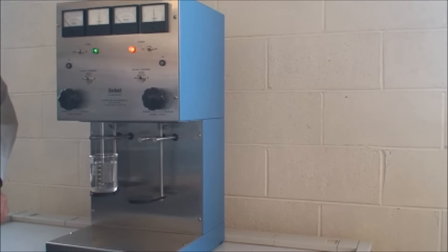Now, at that current density, a typical plating would take approximately 12 to 16 hours. It's an endpoint analysis, so you want to make sure you get all the ions onto the plate.